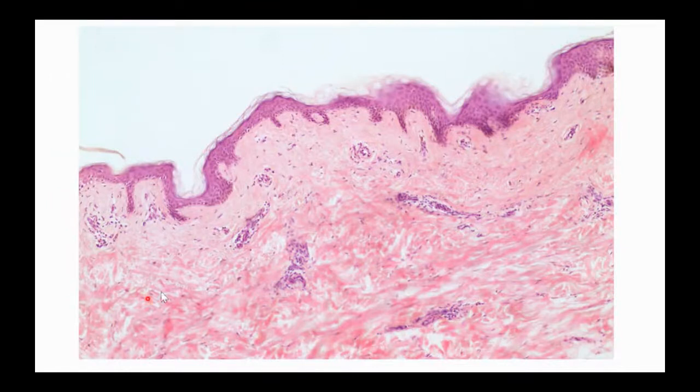This hot mess down here is the reticular layer of the dermis. This is where we found the dense irregular connective tissue. Those proteins that are going nuts, going all over the place, we can see those here. Up here is where we found areolar loose connective tissue, where I don't have quite as many proteins as down below. We have a few more fibroblast cells mixed in. That's the areolar connective tissue up here. And then here on the very outside is where I have the stratified squamous epithelium.